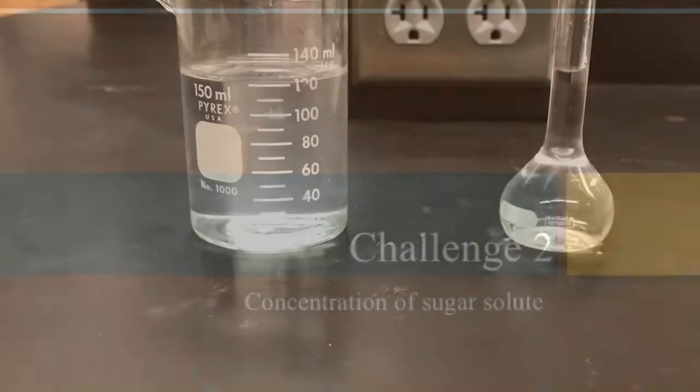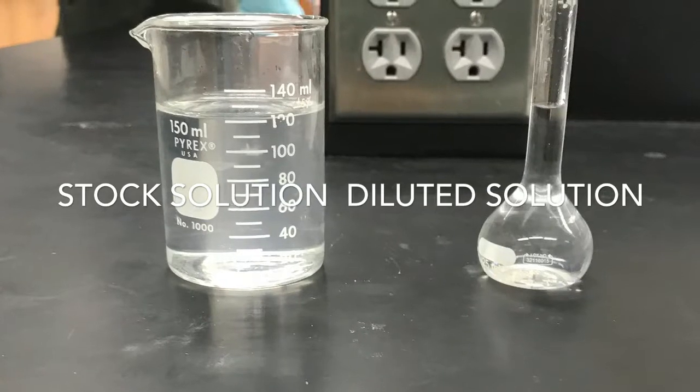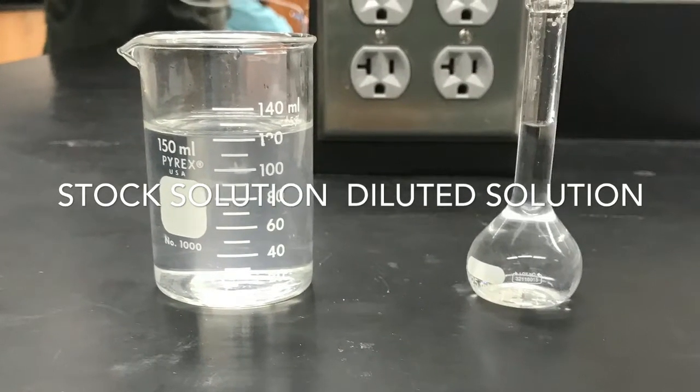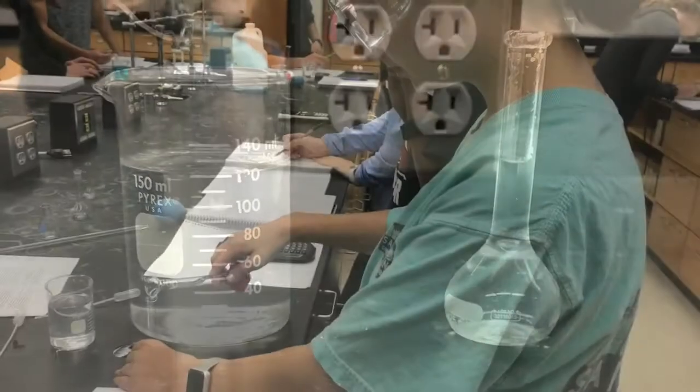Next, we will take a stock solution to prepare a dilution. A stock solution is prepared so that you can make solutions of lesser concentration from it. A dilution is created from the stock solution to make solutions of lesser concentration.